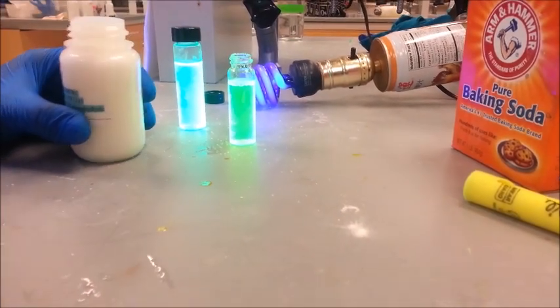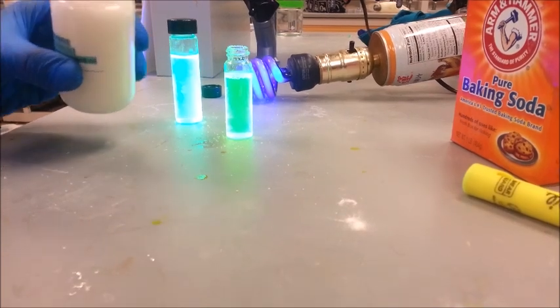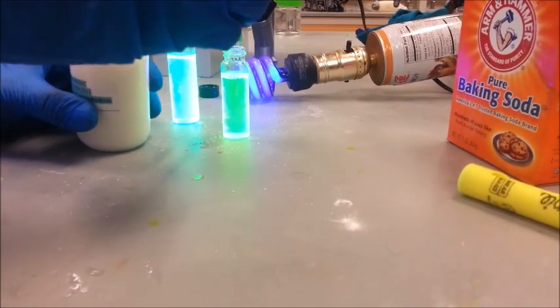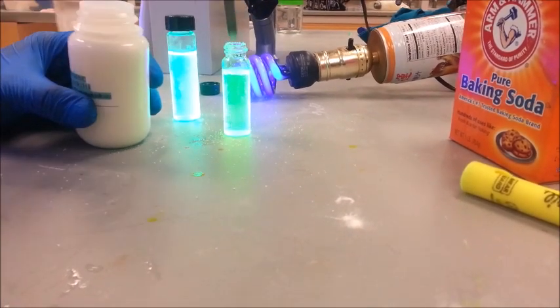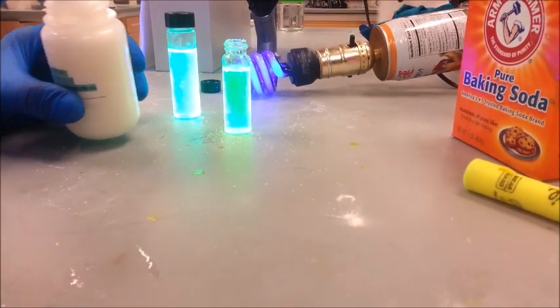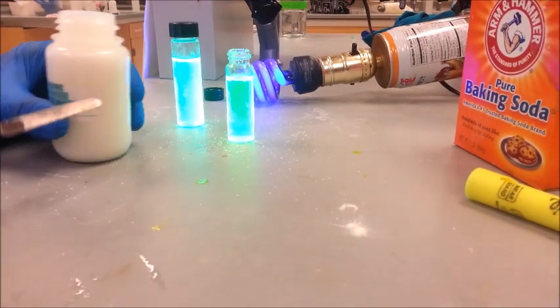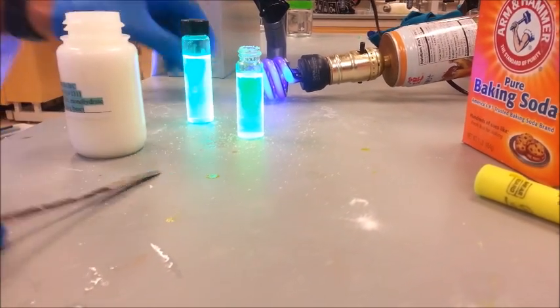Citric acid is added to a neutral solution on the right to lower the pH. You can already see that the solution's fluorescence is changing as citric acid is adding. A good shake will even out the color.